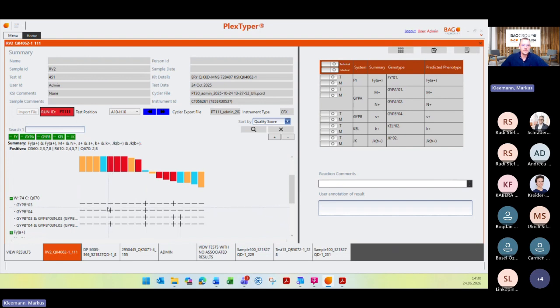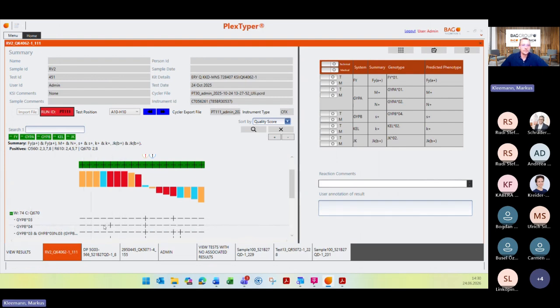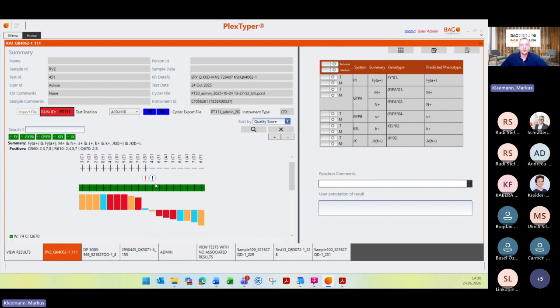So I look at this one here. You have to be here a positive call, and also this one has to be positive. So when I look at this reaction again, you can see this is like a really good positive example. And for this genotype, PlexTyper needs this as a positive call and also this one here. The next different reactions here have to be negative for this. And that's why it is sometimes a good indication that you can compare your results with this show alleles function to find out, is it a correct positive result or not? Do you have to repeat your samples? So my conclusion to these warnings here, especially this critical warning, these are marks that help, or that show, okay, I have to look manually at this curve here.